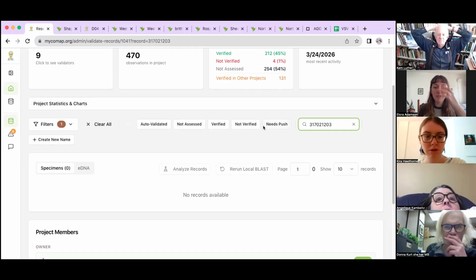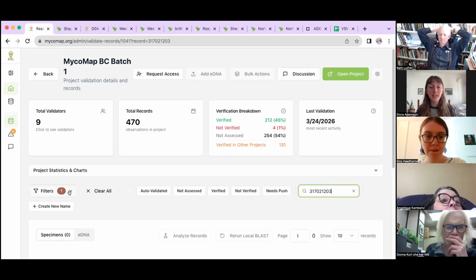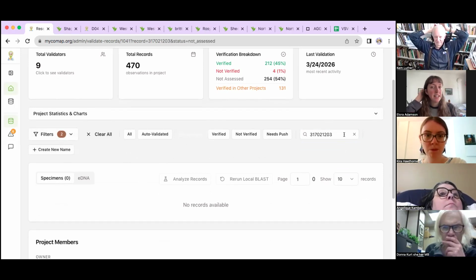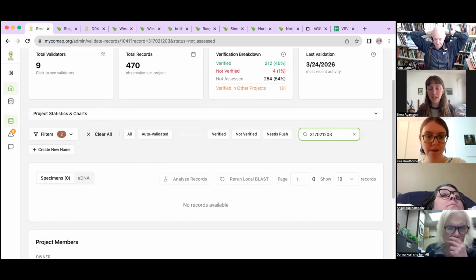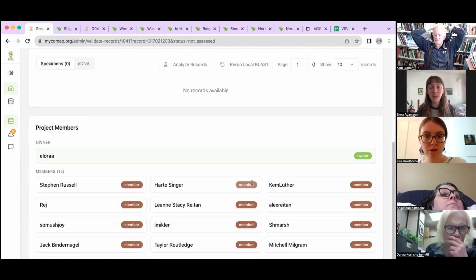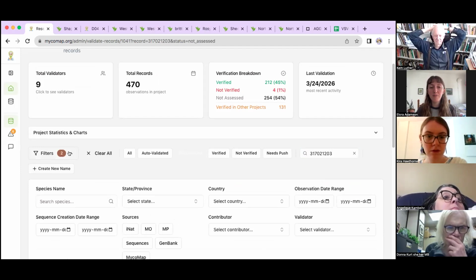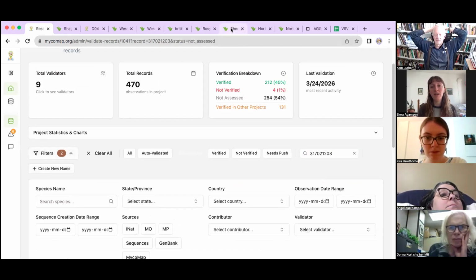Yeah, because the thing is, if we're not using the spreadsheet, what I've been doing is validating by species or genus. I search Russula, and then I look at all the Russulas and pick one. When I'm checking the auto validation and there's already a name on them, I can see we have like 12 Russula americana in this list. So I look at the BLAST searches for one of them, I read Danny's notes, and I make sure I feel good about the Russula americana ID. And then I basically validate all of the auto validations for that species and paste the same comment into all of them.